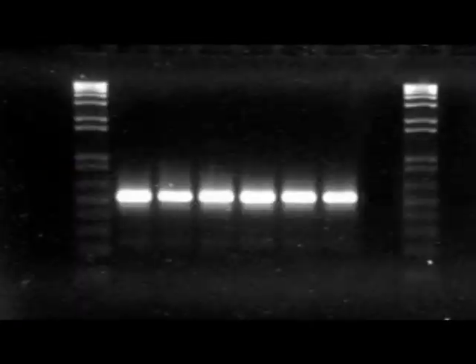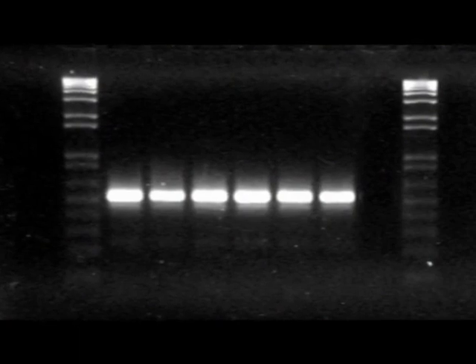Both our PCRs have worked. In the first lane, we have the DNA size marker. In the next 6 lanes, you can see the band from the PCR, and lastly, the blank negative lane. To find out which sex our birds are, we will need to digest these PCR products with a restriction enzyme. To find out how genetically different they are from each other, these PCR products will need to be sequenced.